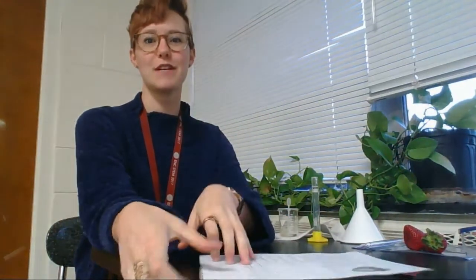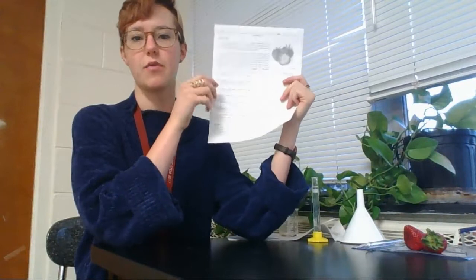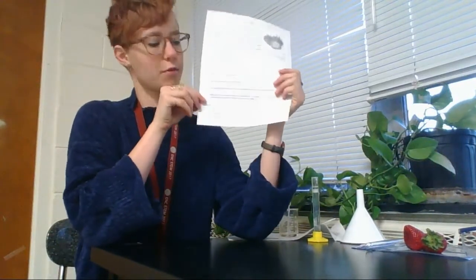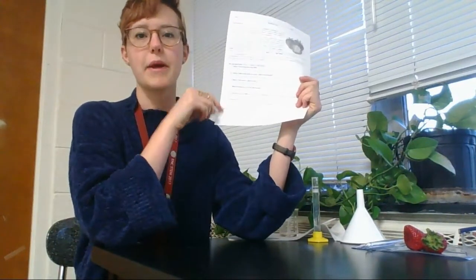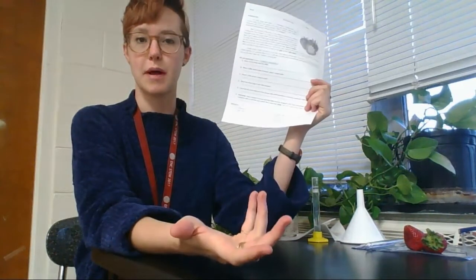Today you guys are going to be doing a strawberry lab where we crush up strawberries and we pull out their DNA. For this lab, make sure you have your handout with you and to start off, read through the materials and make sure you go get all your materials from the supply station. Go ahead and pause the video now and go get your materials.